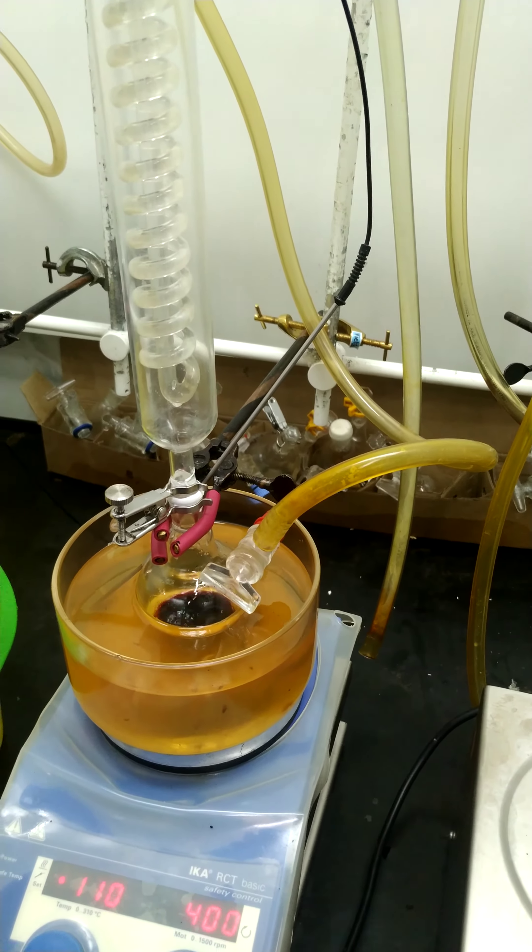In this way, we are heating the oil, and the oil gives heat to the reaction mixture, which vaporizes the solvent. The solvent gets condensed and comes back down to the reaction mixture. This is what a reflux reaction is.